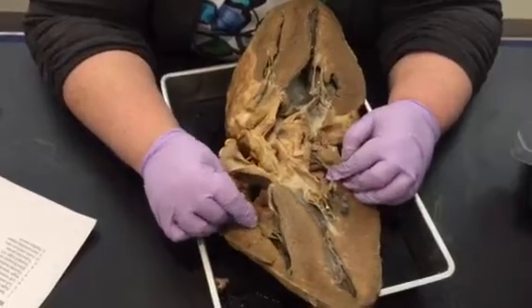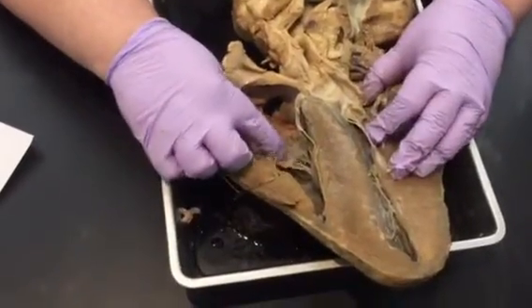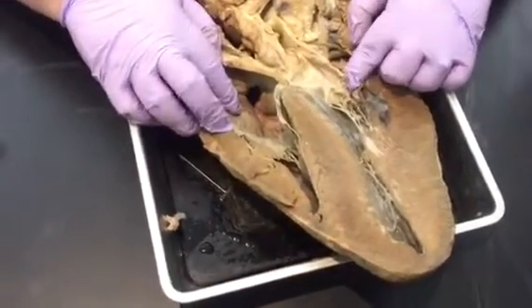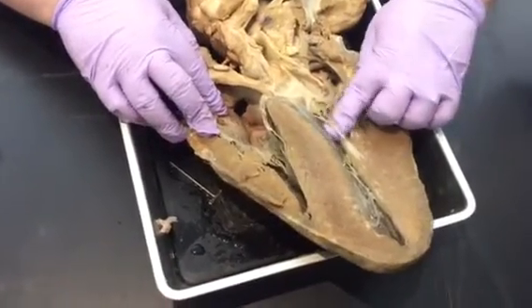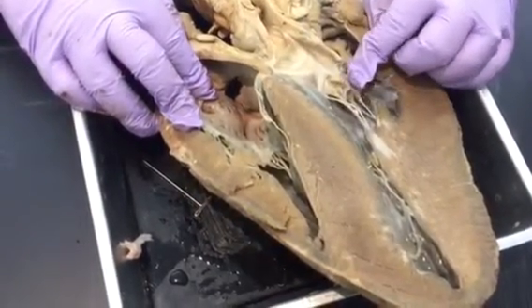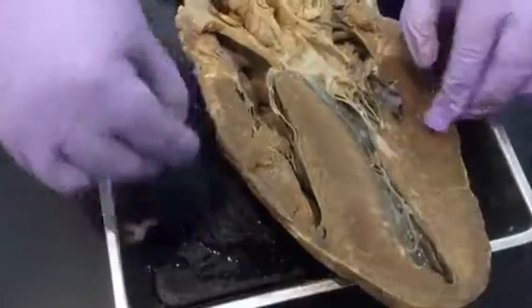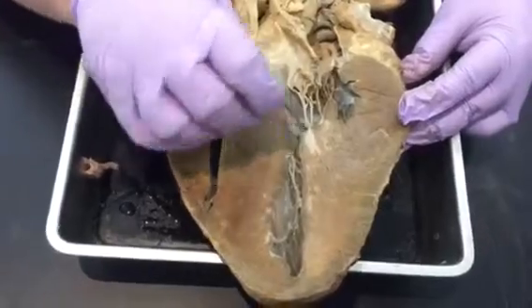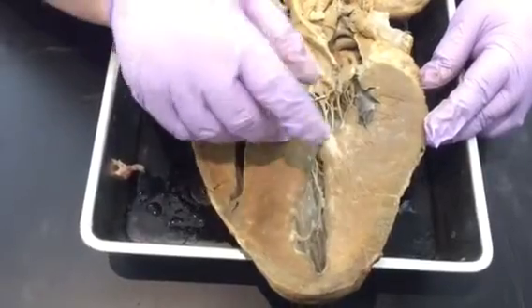The right side has your tricuspid valve — right to tri. So this is the tricuspid. And then this side has our bicuspid, because you've got to try it before you buy it. Tricuspid, bicuspid. They're held down by these strings called chordae tendineae. The chordae tendineae are attached to the ventricular wall through these muscles called the papillary muscles.